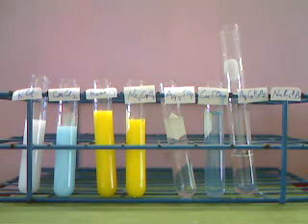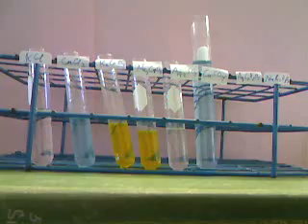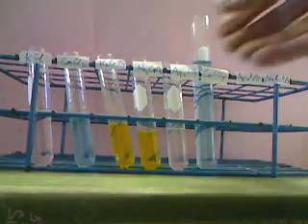And so there's our result for the silver acetate with the remaining 6 solutions. So now we've combined all the solutions in that row on our table. Now I have to go down to the next row and combine the solutions in the next row on our table. We'll now add copper sulfate to our 6 remaining solutions. Stir them together and see what happens.